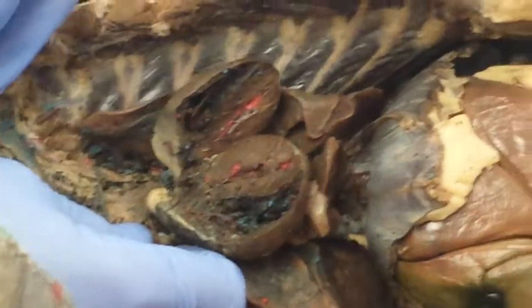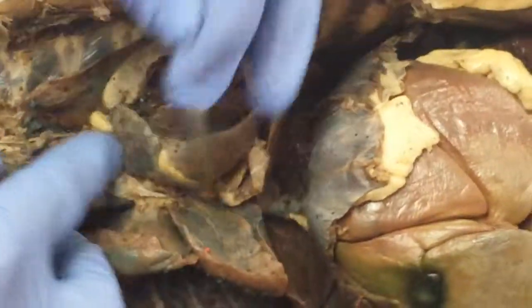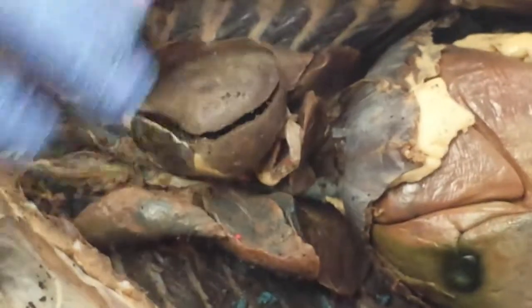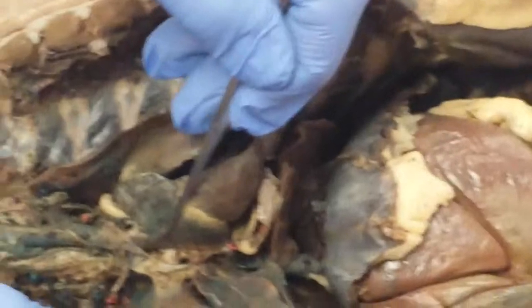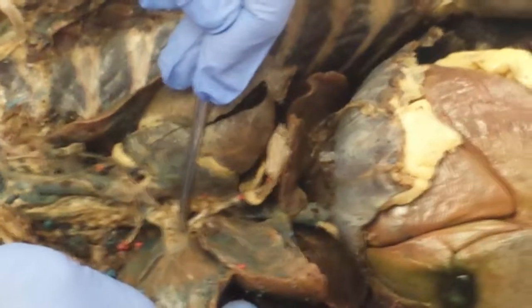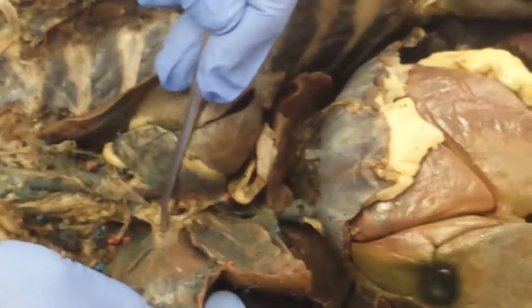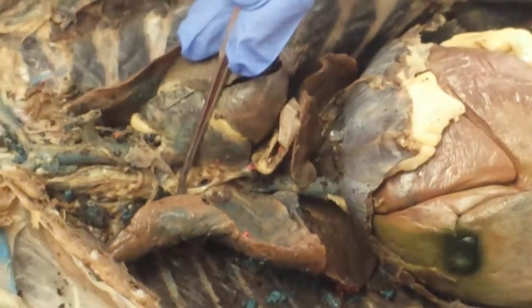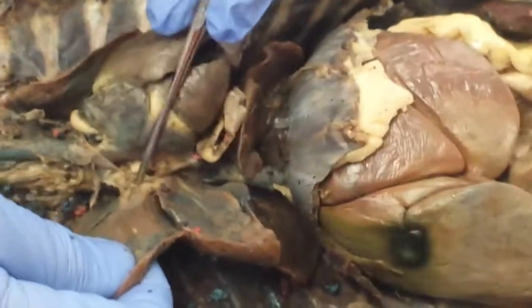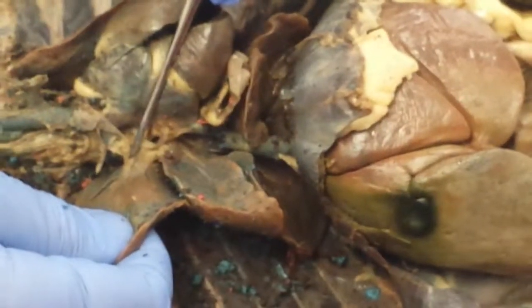But you also remember you have the trachea coming down. I haven't taught you this yet, but where the trachea bifurcates into the right and left main stem bronchi is called a carina, C-A-R-I-N-A. The right and left main stem bronchi enter the hilum of both lungs right with the pulmonary arteries. So the right main stem bronchus and left main stem bronchus are going to be entering into the hilum of the lung together with the right and left pulmonary arteries. Okay?